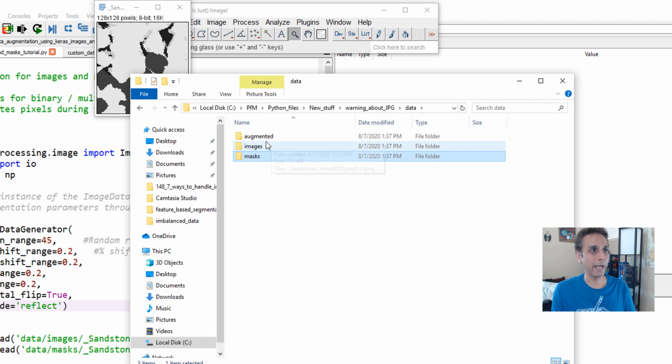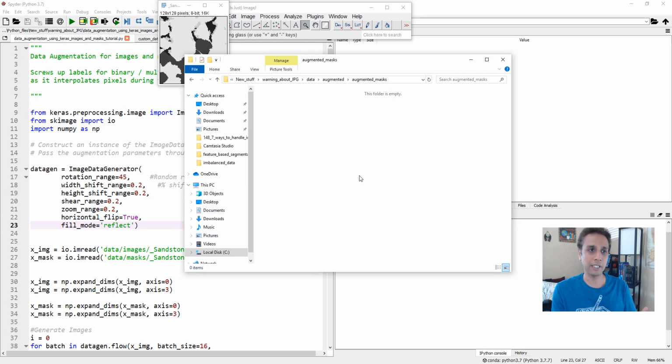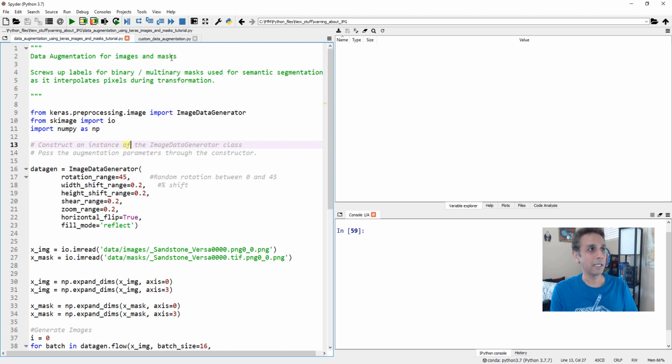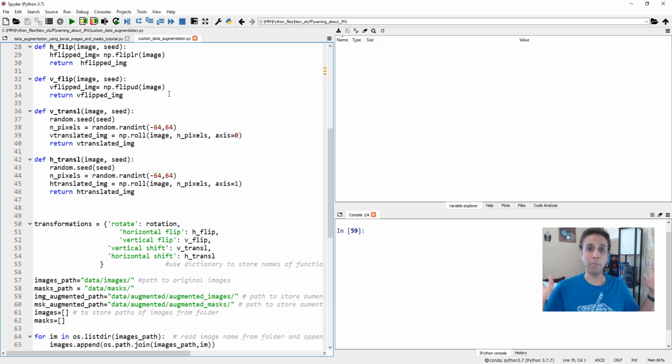So let's go back to our augmentation. You see my folder is empty. Let's augment some of these images. In the last tutorial, I went through the Keras image data generator and said it adds some artifacts, so go ahead and watch that. I don't want this to be a repetition of my last tutorial, but I have written something that, well, probably not better than Keras, but at least solves the problem I was encountering, which is changing the pixel values of my images and masks. Images also, but masks, it's more important.